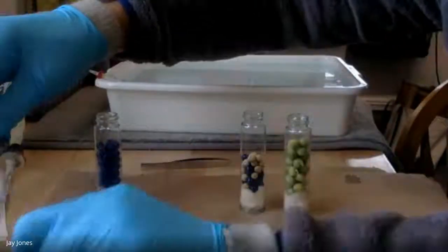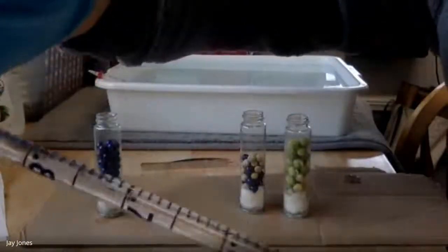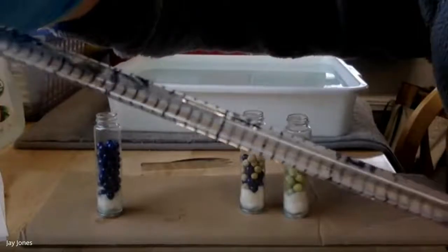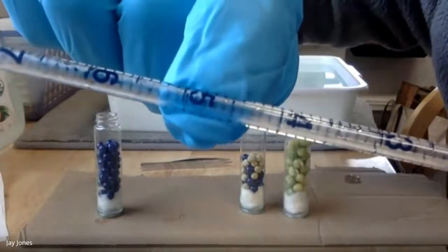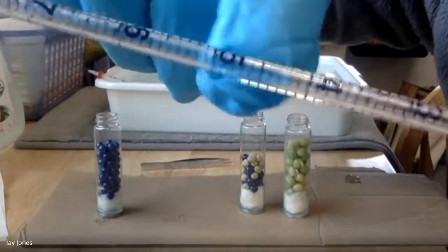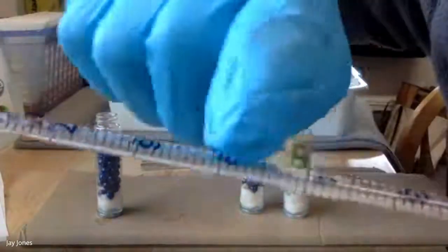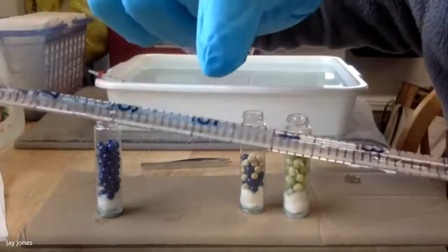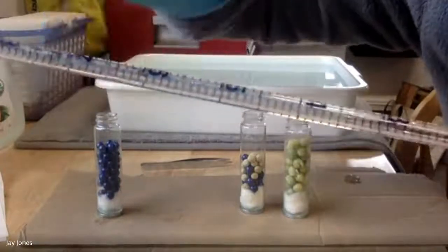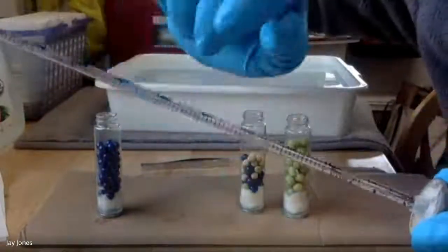I'm going to take these stoppers with 1 ml pipettes in them. The 1 ml pipettes are graded to 2 sig figs, meaning I can read them, for example right there, it's 0.5, and then hundredths: 0.51, 0.52, 0.53, 0.54. So I could tell to 2 sig figs, 0.01. I'm measuring to the hundredth place. Sure, I could estimate the third, but I'm not going to. We'll just do it to 2 sig figs.